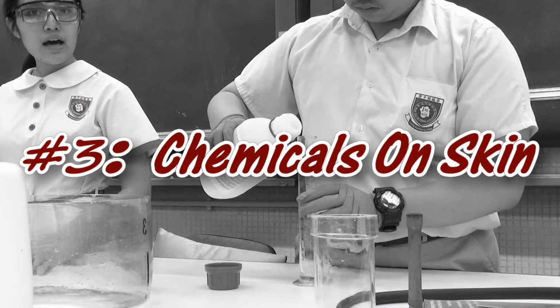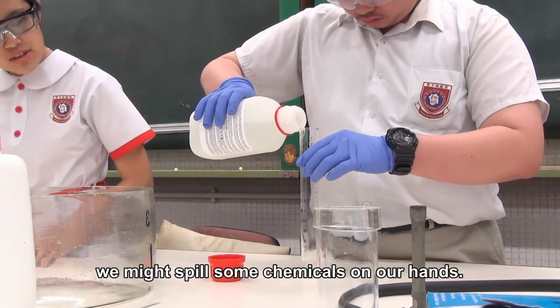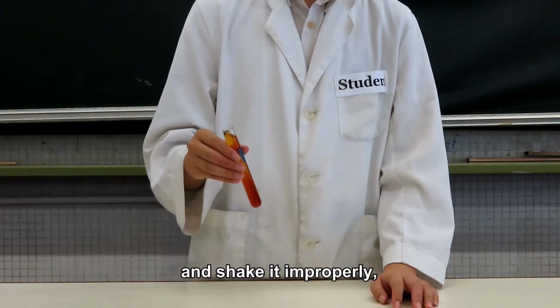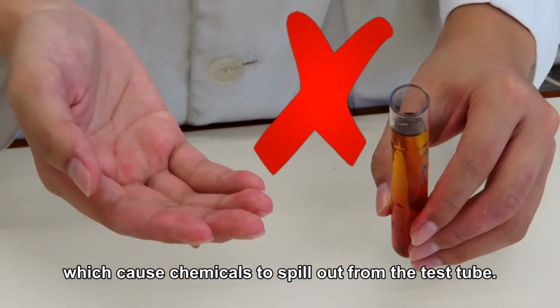Chemicals on skin. When handling chemicals in the laboratory, we might spill some chemicals on our hands. For instance, one may put too many chemicals in a test tube and shake it improperly, which causes chemicals to spill out from the test tube.